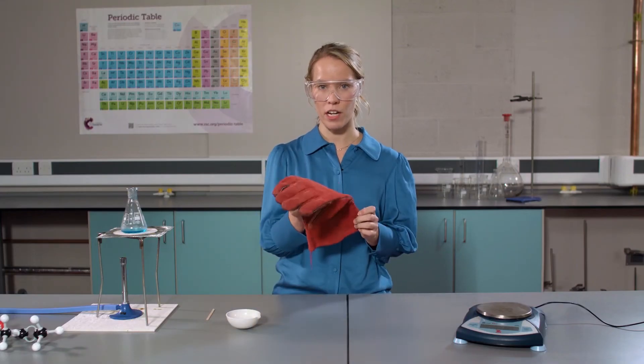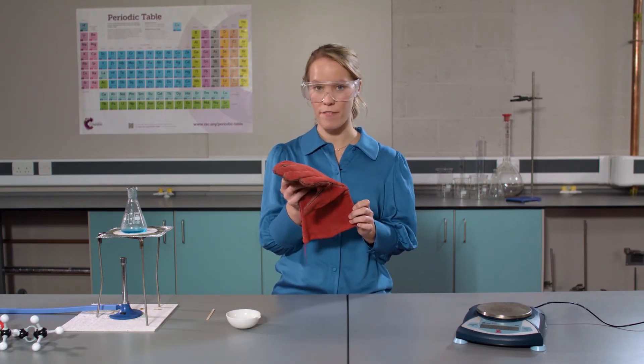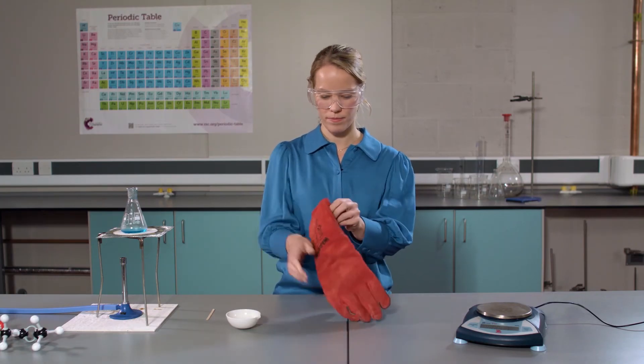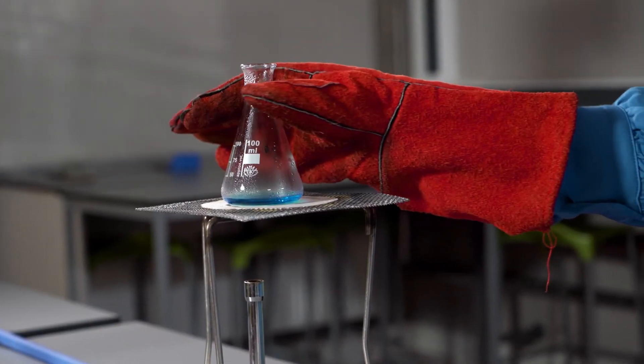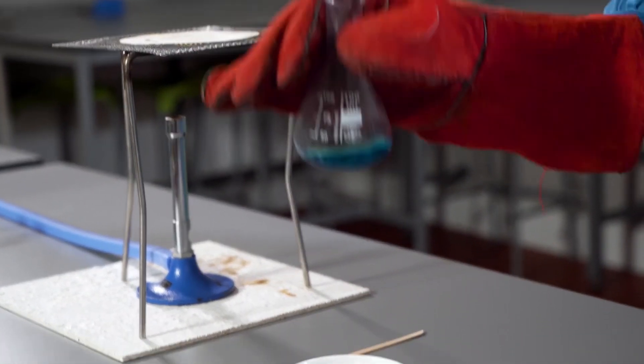I'm going to use a heatproof glove to pour the hot solution into the evaporating dish or petri dish. Pour it carefully.